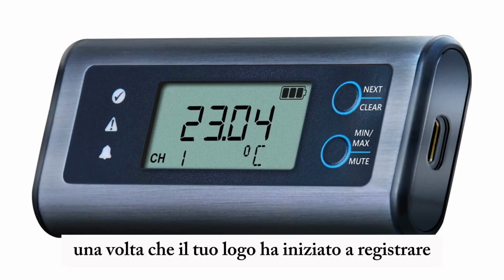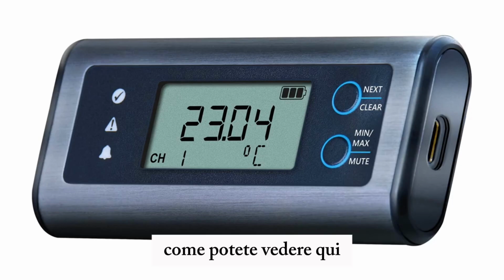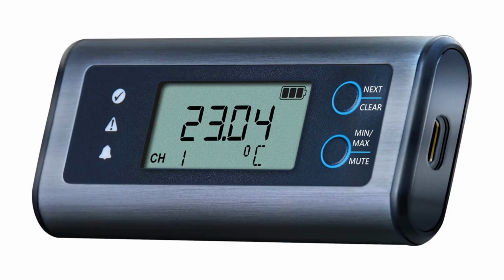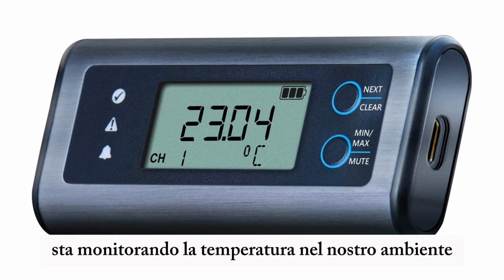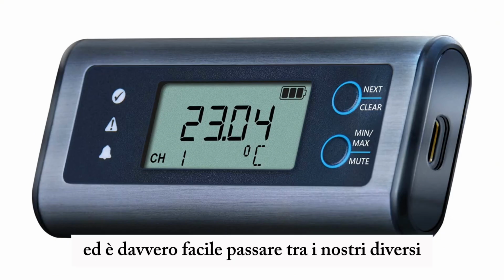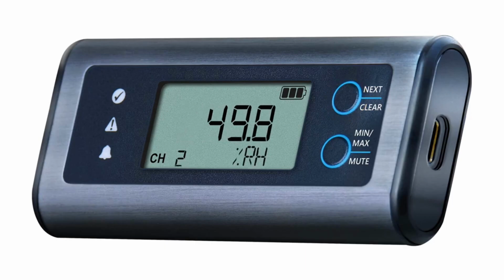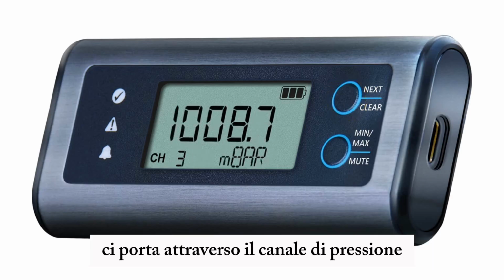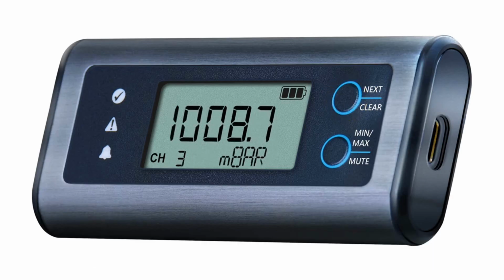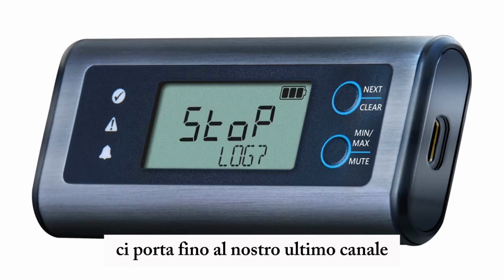Once your logger has started logging, this is the first screen you will see. And as you can see here, this screen is the temperature channel. This screen shows us that it's monitoring the temperature in our environment. And it's really easy to switch between our different channels. A short press of the top button takes us through to the humidity channel. A short press of the top button again takes us through to the pressure channel. A short press again takes us through to our last channel.